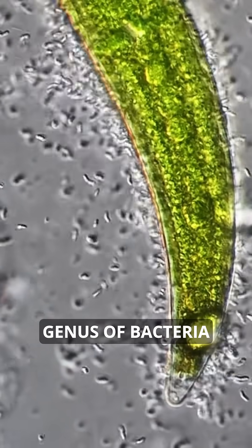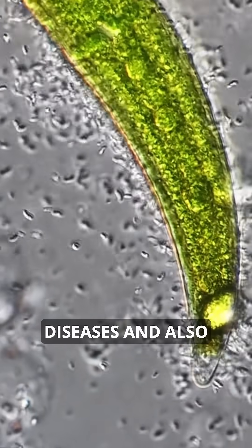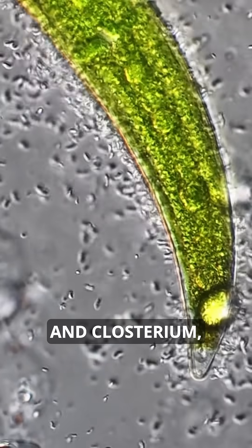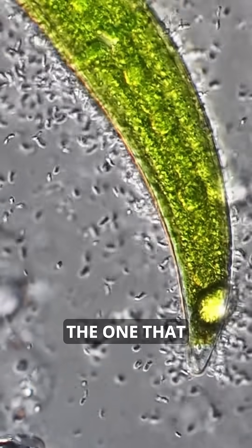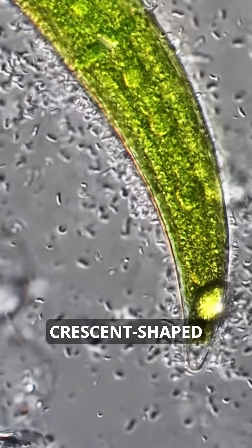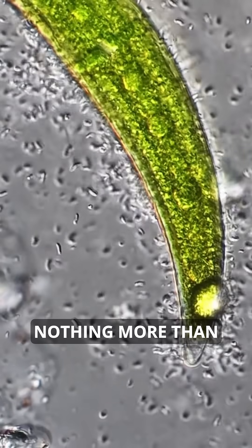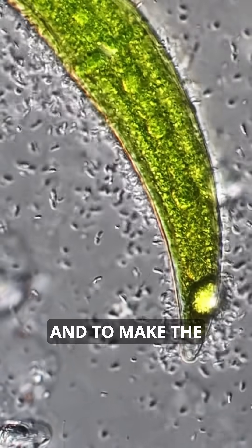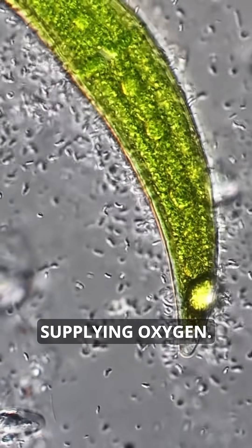Clostridium is a genus of bacteria which can cause diseases and also food poisoning, and Closterium — the one that we have here — is a beautiful crescent shaped algae which basically does nothing more than a little bit of photosynthesis and making the bacteria happy by supplying oxygen.